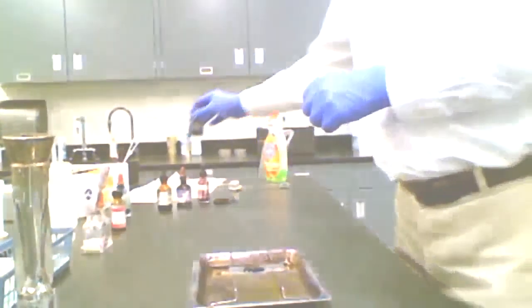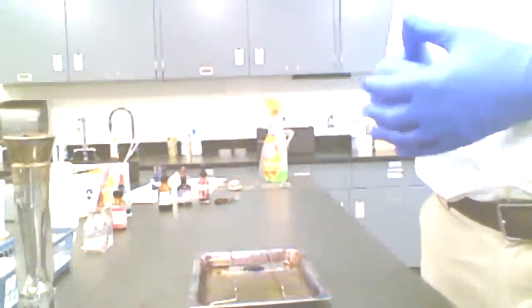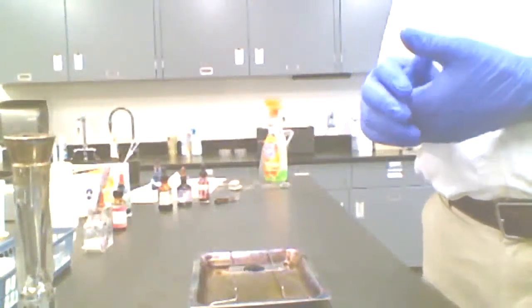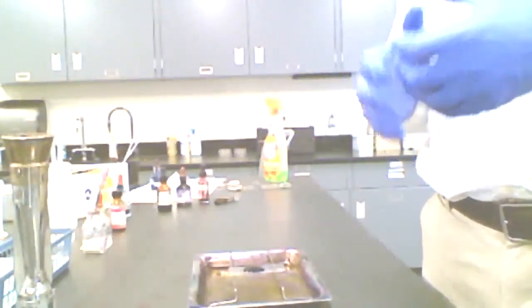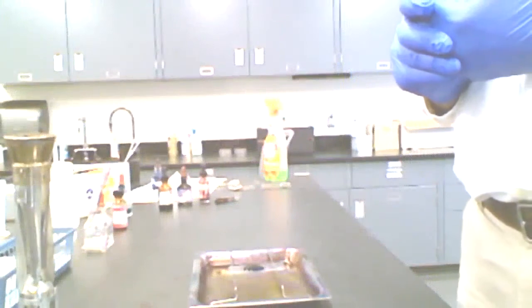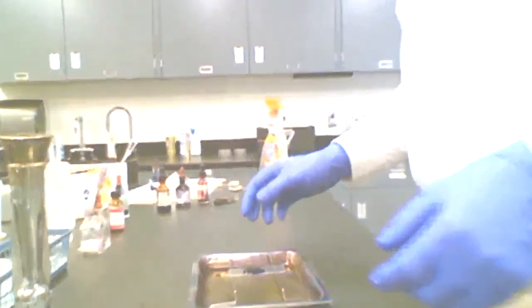completely flooded. And with this technique, there's a little bit of flexibility in terms of how long that's applied, but the rule of thumb is at least 60 seconds. With other techniques, the duration of application of reagents has to be more precisely determined. But here I'm just going to keep that on there for about 60 to 90 seconds, somewhere in there is going to be adequate. I don't know if you can see what the slide looks like with the smear on it. Let me see if I can angle it down, pull it closer.